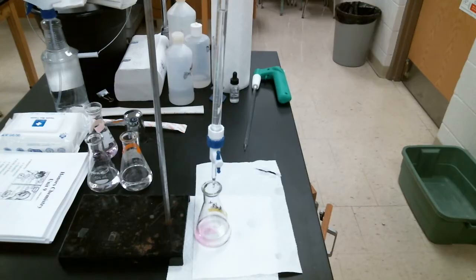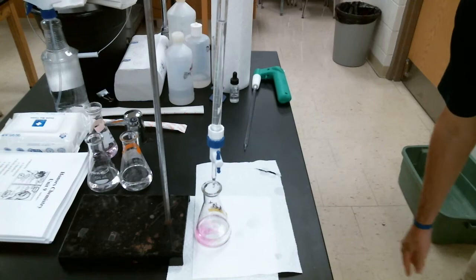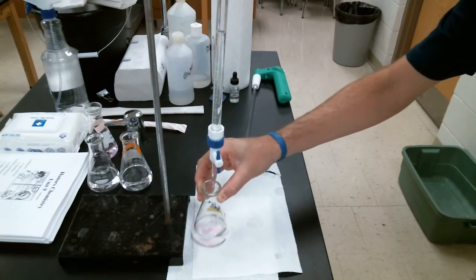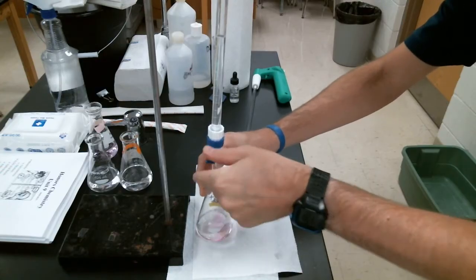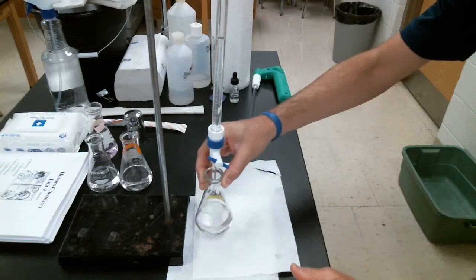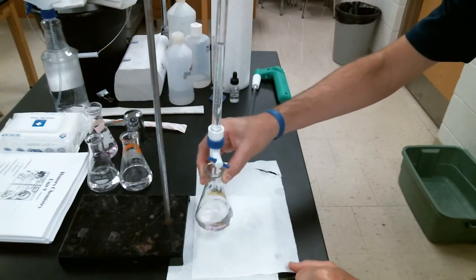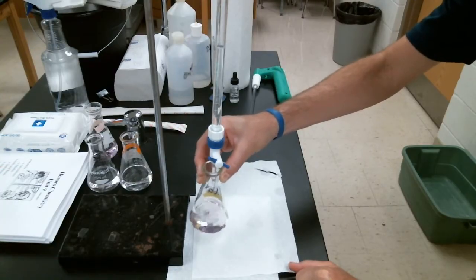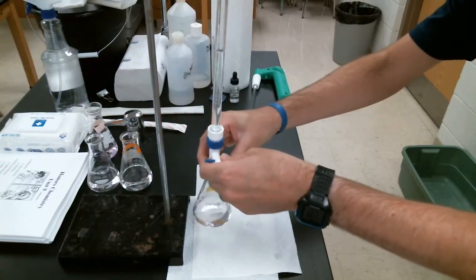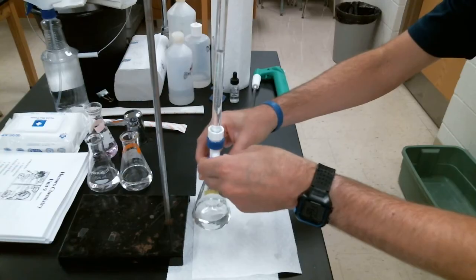All right, I just want you to see the end of this third titration. About 15 milliliters out at this point, being a little lazy, haven't swirled, but there we go. We swirl, we make it react. Let's start to slow this down a little bit. And we're swirling. That pink color is staying quite a bit longer. We're going to get probably close to where we were in the last couple trials, so let's slow this down a bunch more, just a couple drops.